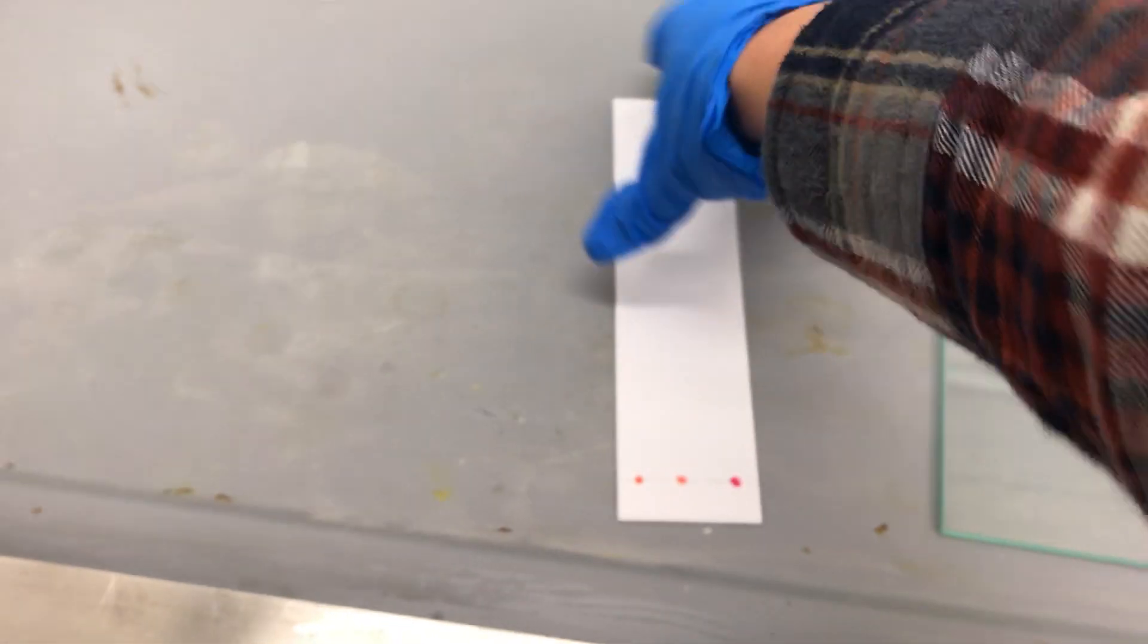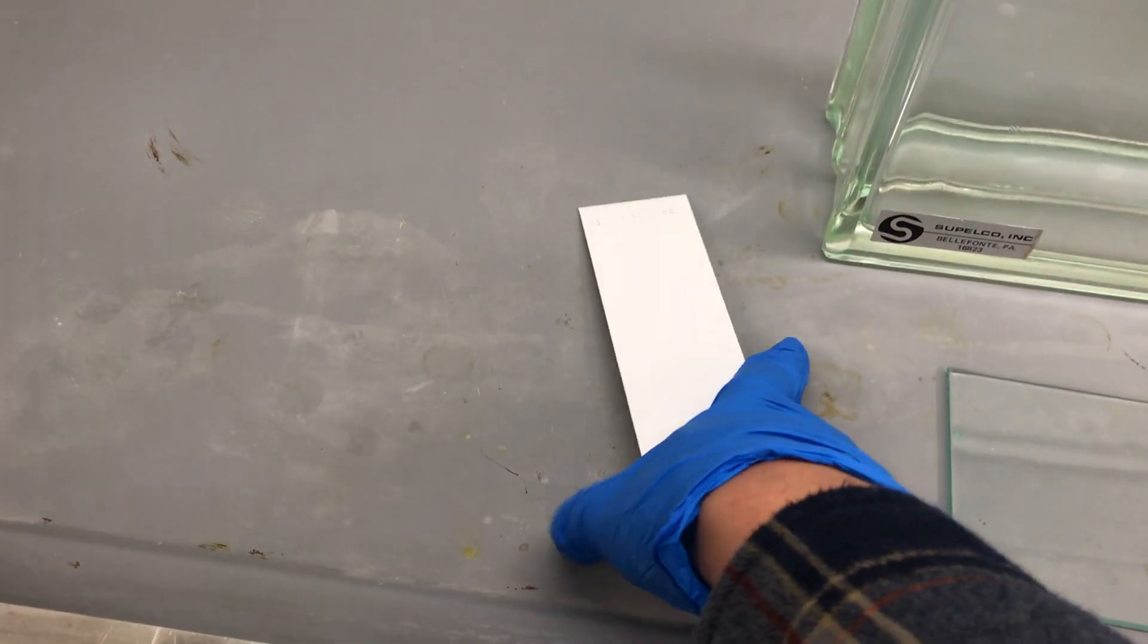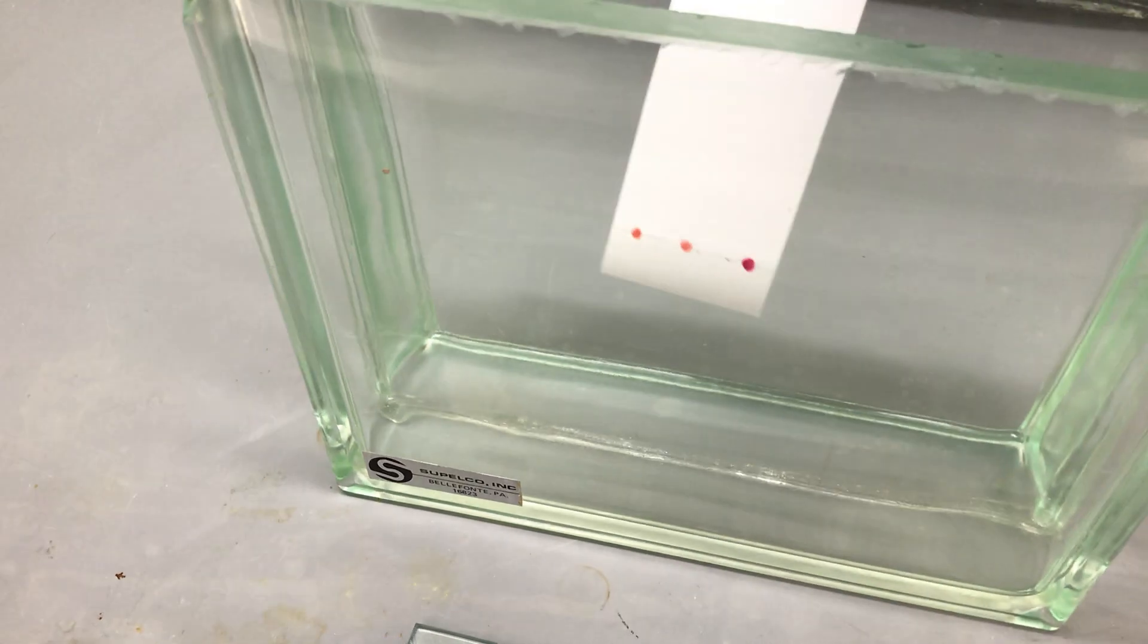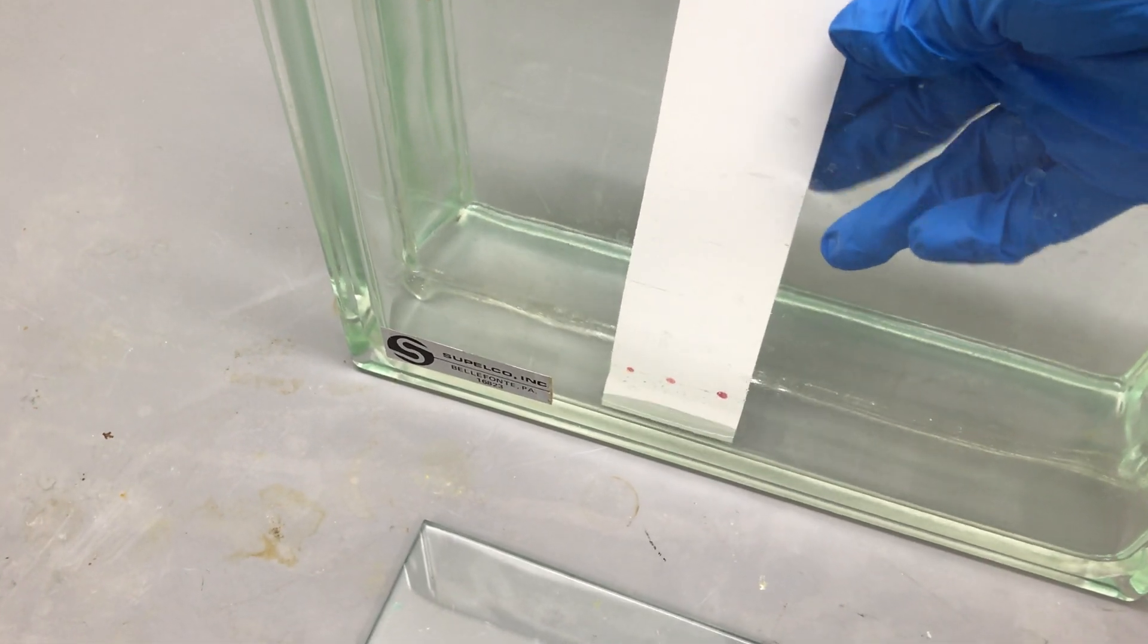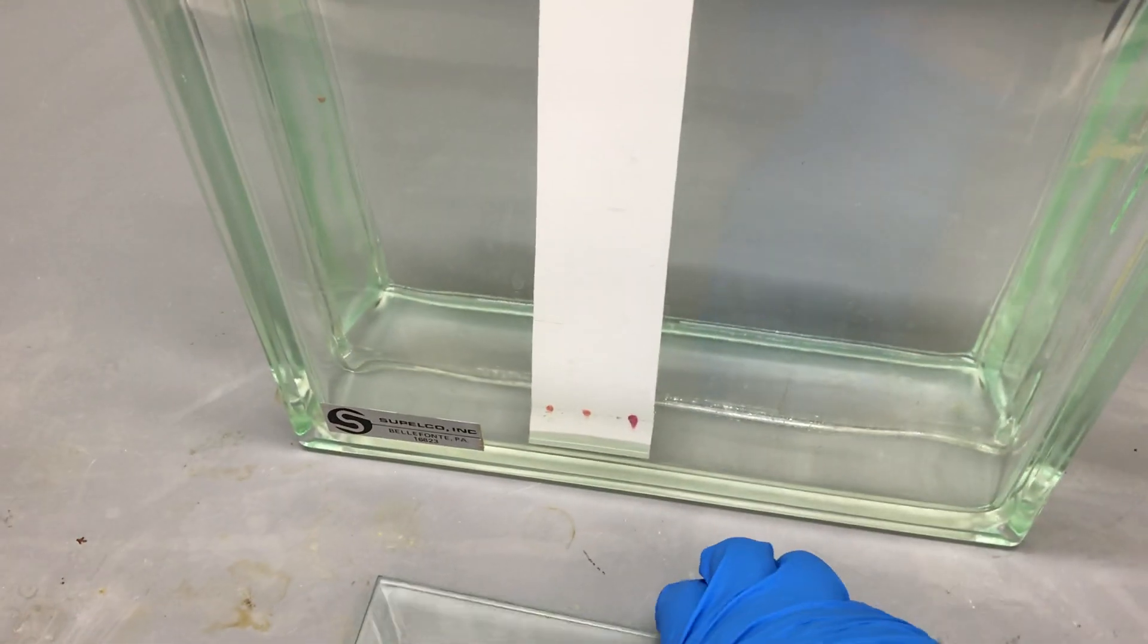We're gonna grab our plate here, like so, and then we're going to place it very carefully into our tank, like that.